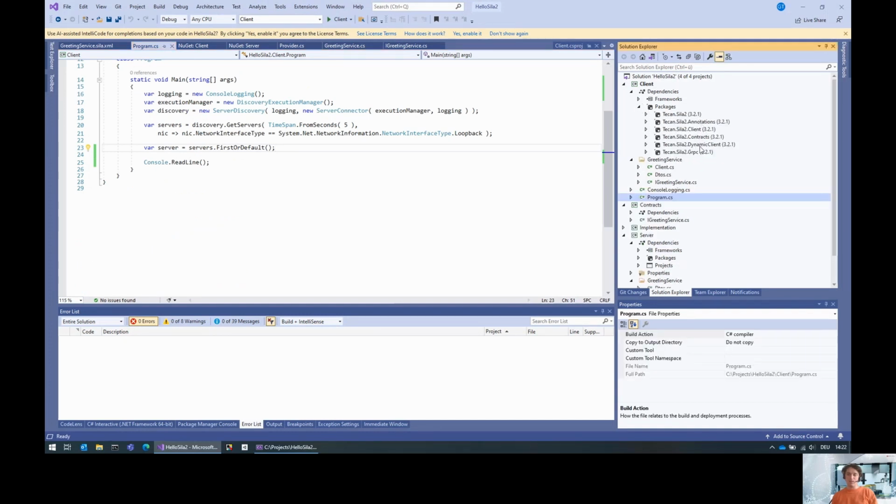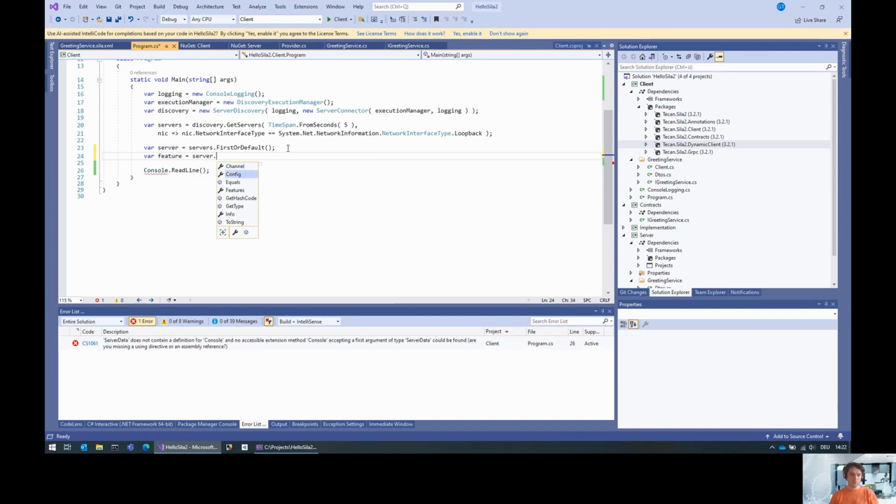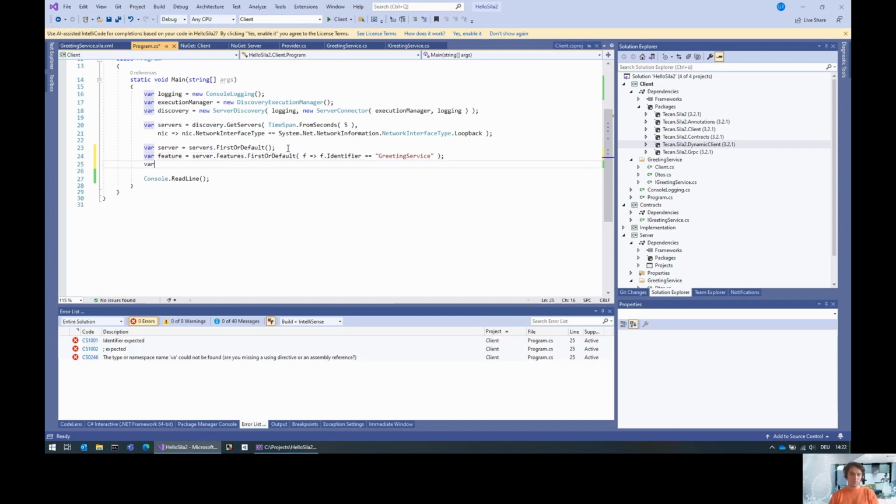For this, I already added the NuGet package, because everything is a NuGet package, as you might have grabbed by now. It's basically the dynamic client package that we need. To use it, we need to know which feature we are talking about. So the feature is the first or default feature in server.features that has the identifier set to greeting service. And we'll be interested in the command: feature.items of type feature command, first or default.